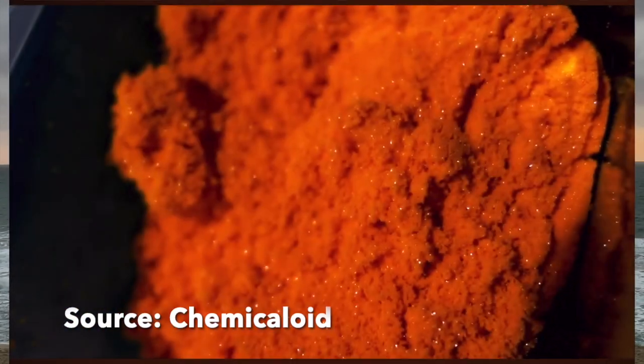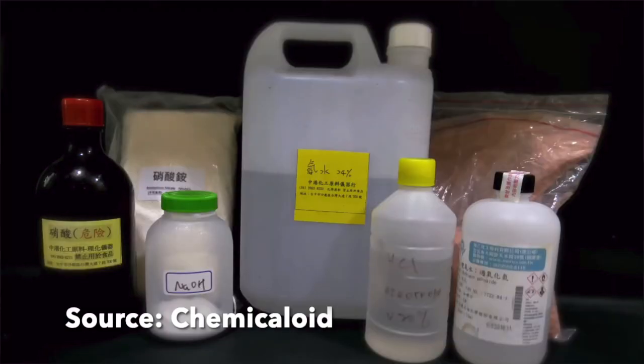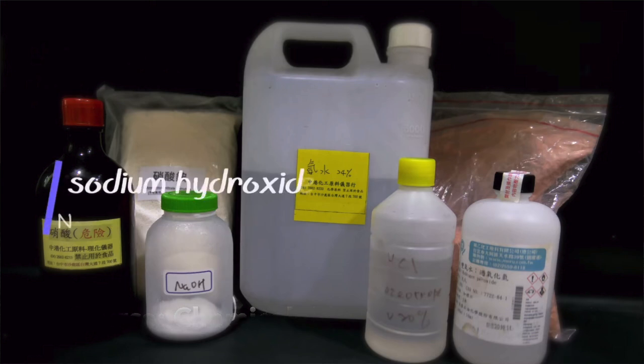But I don't have any use of it, I just want to make it because it has a nice reddish orange color. In terms of chemicals, this is what I use. In the back I have 68% nitric acid, ammonium nitrate, ammonium hydroxide, and cerium oxide glass polishing powder. In the front there are sodium hydroxide, hydrochloric acid, and hydrogen peroxide.